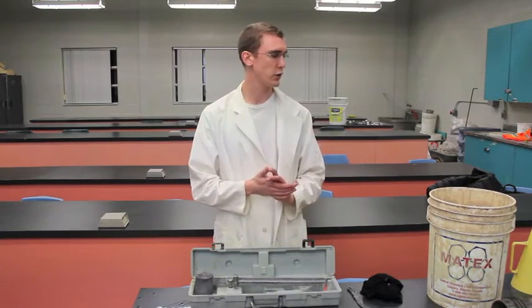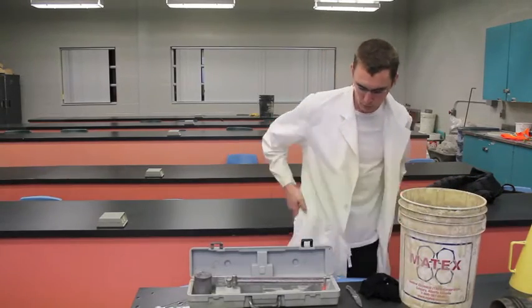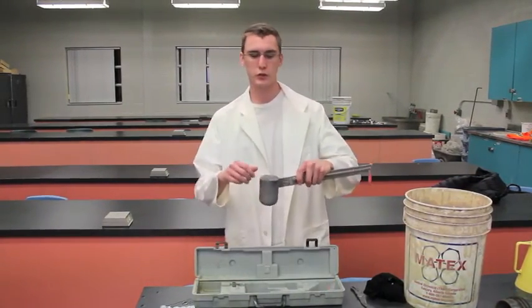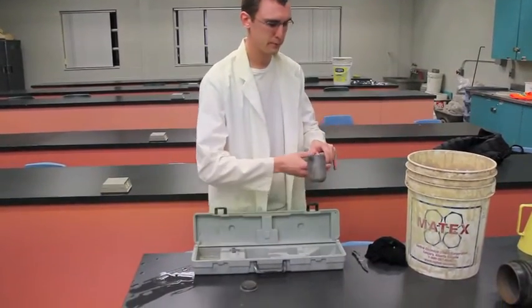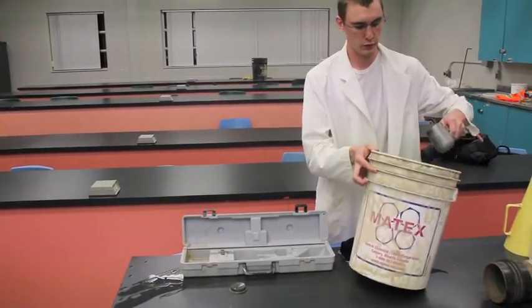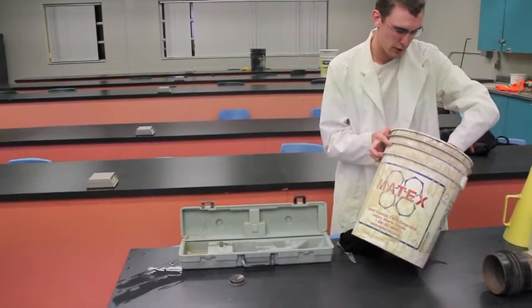So for this test by now your mud is going to be thoroughly mixed in the container and what you're going to want to do next is you're going to want to take your scale here, make sure it's nice and clean, take the lid off. We're probably going to have to tip the bucket for this and we're just going to make sure that we have a nice full measuring cup of mud.